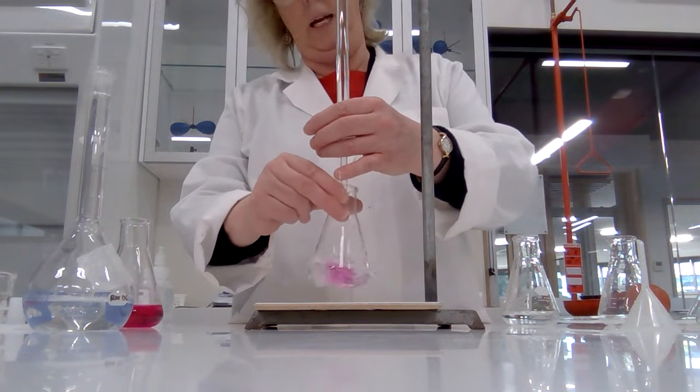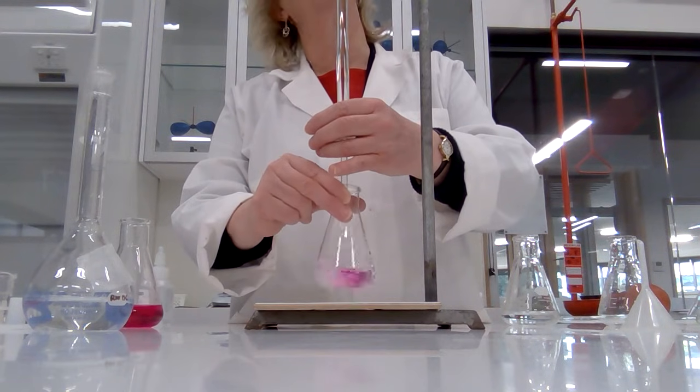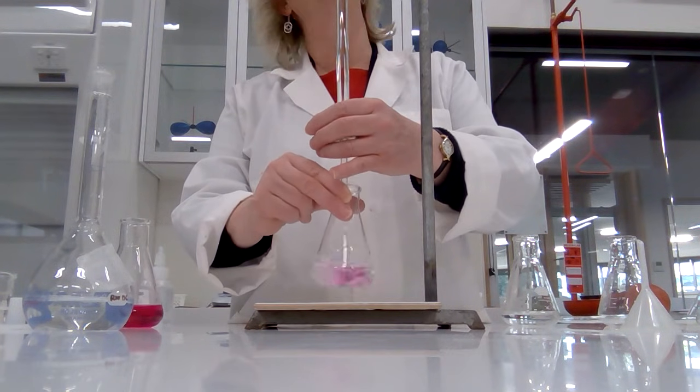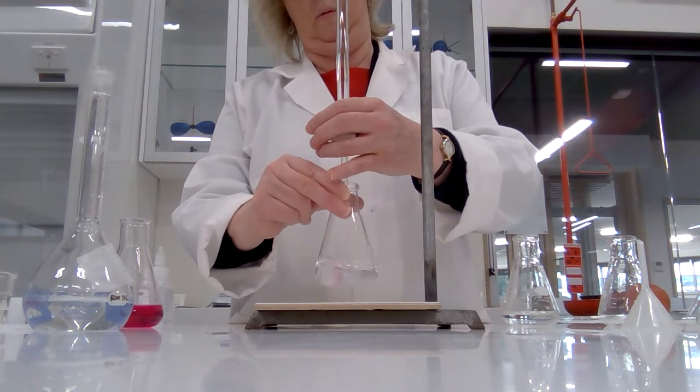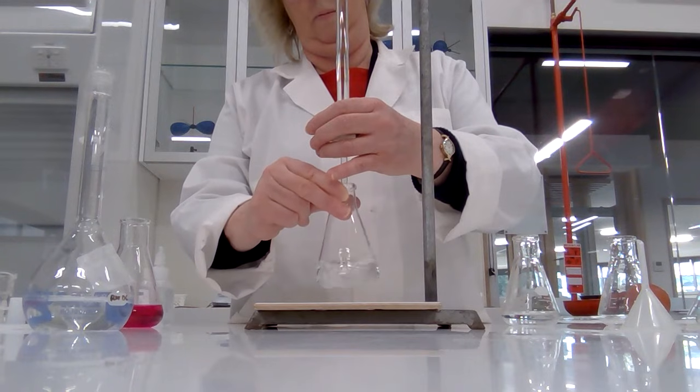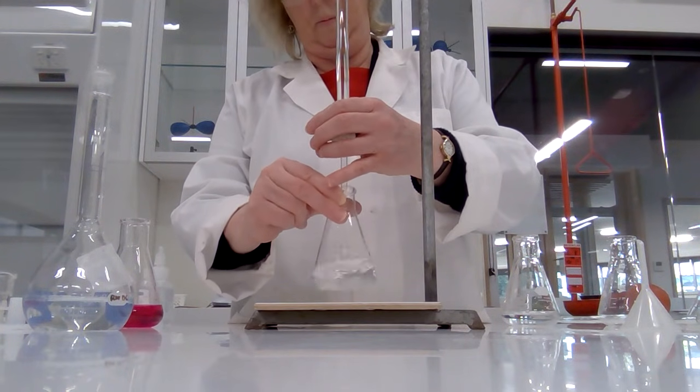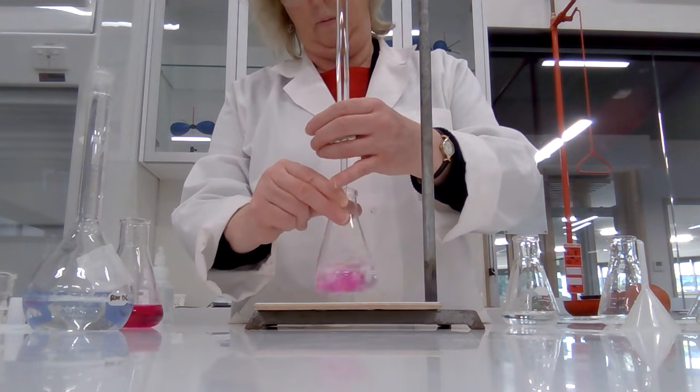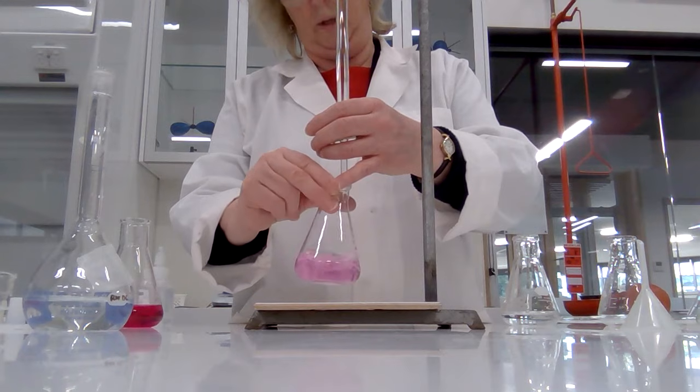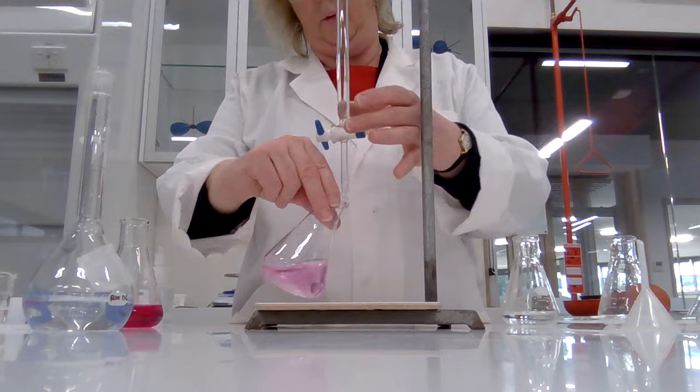Once again, pink color appears but it disappears when I swirl. Getting very close now, so I need to slow down. There we go. Yep, that's pink.